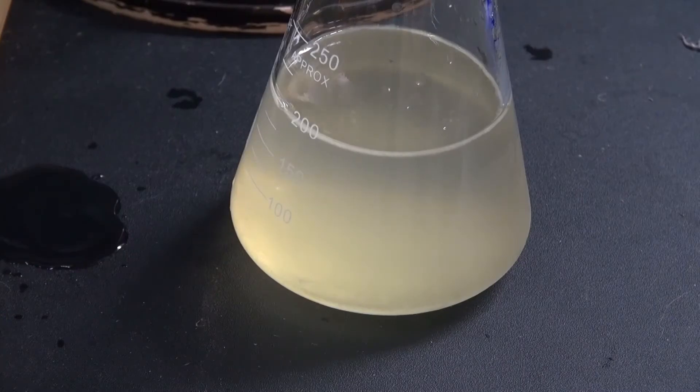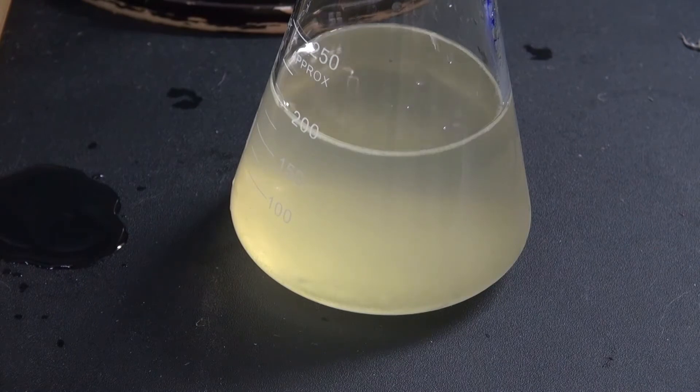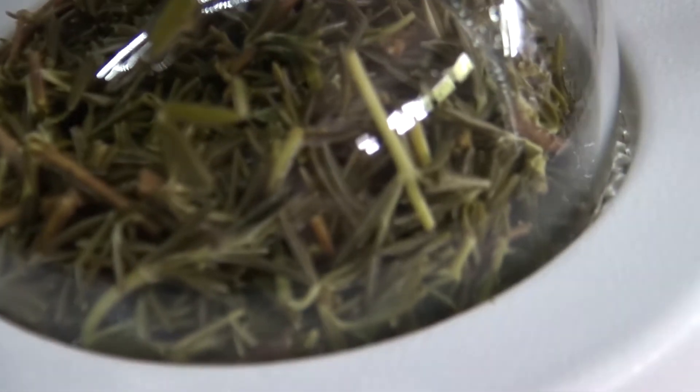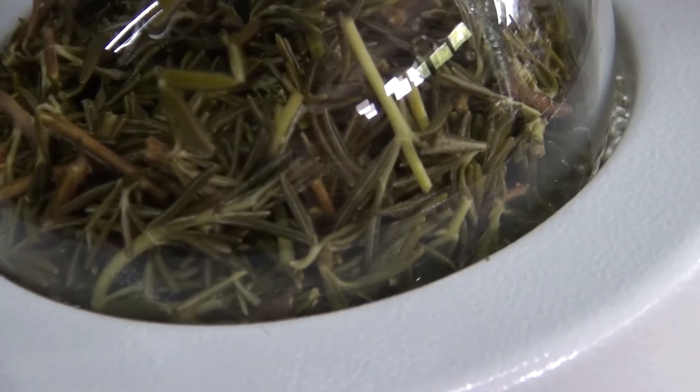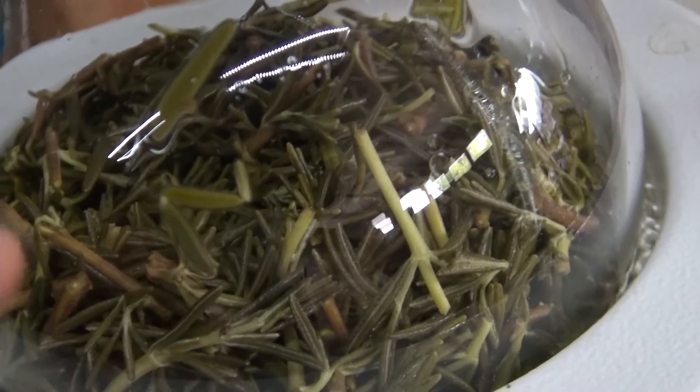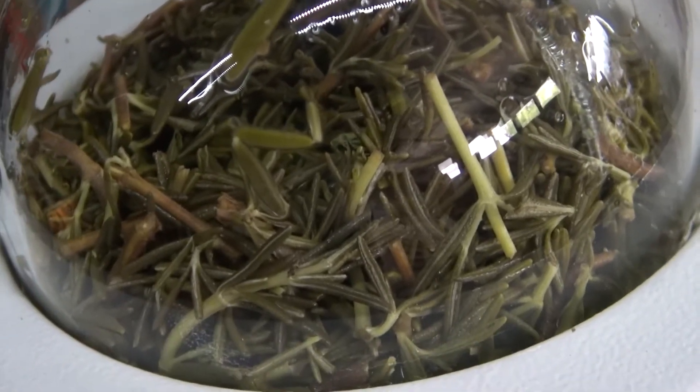One more hour later, and this is what I've collected. As you can see the rosemary is slightly spent, you can tell by the discoloration. But right now I'm going to stop the process because the results are not the color I was looking for, so I believe there's some contamination.